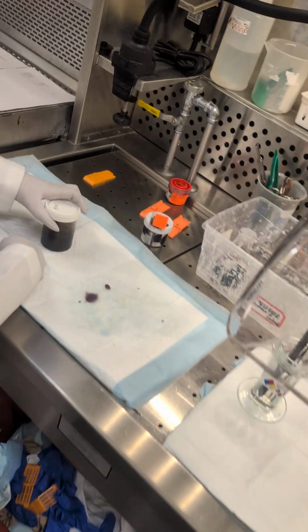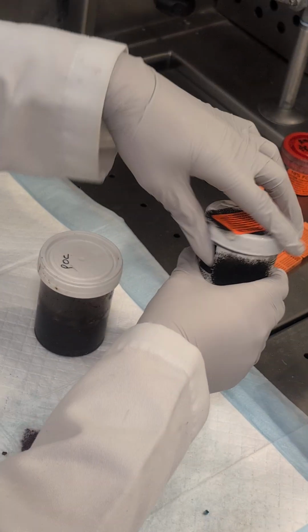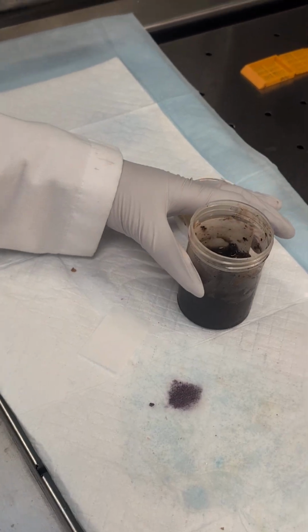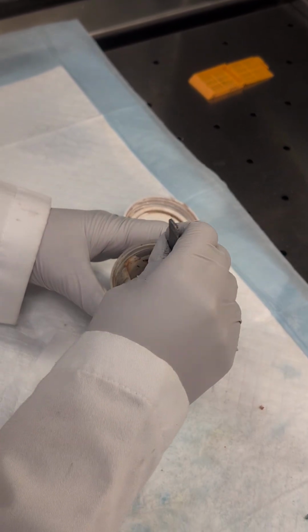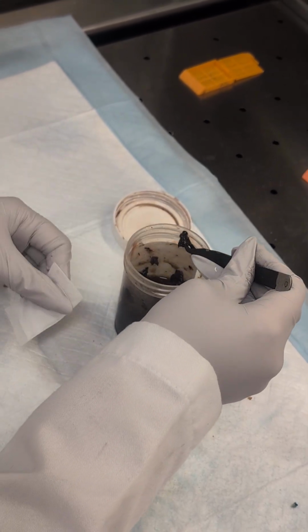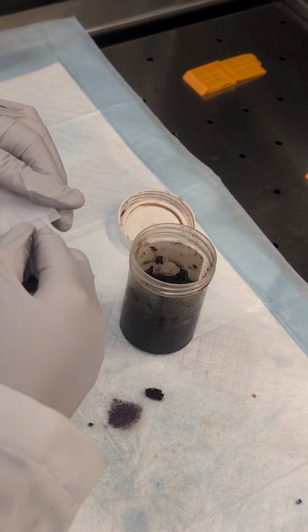So with these, what you're going to do is, this is very tiny. I'm going to have to scoot over here. I'm just going to put this cyst away. So for your POC, it's not fully going to be like an aggregate, and that's what we're trying to visualize with this. You're going to open up your bag. This is just so you get the experience to see as much as you possibly can here.